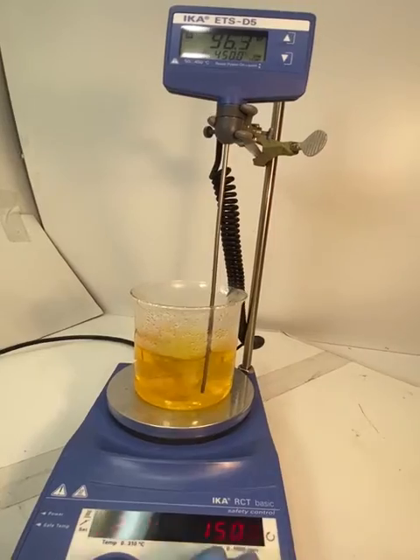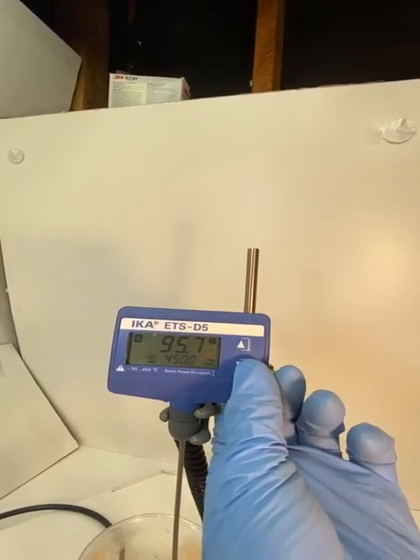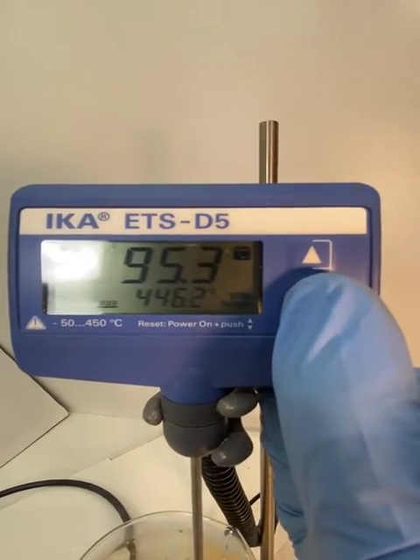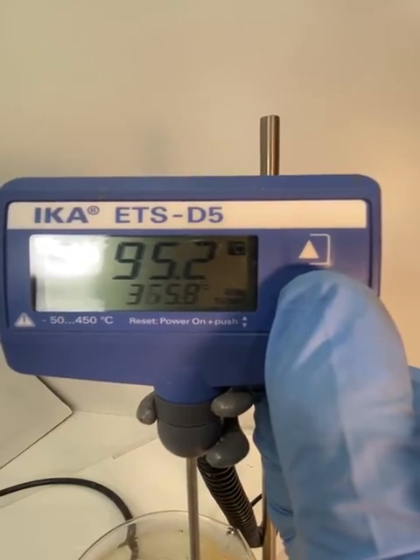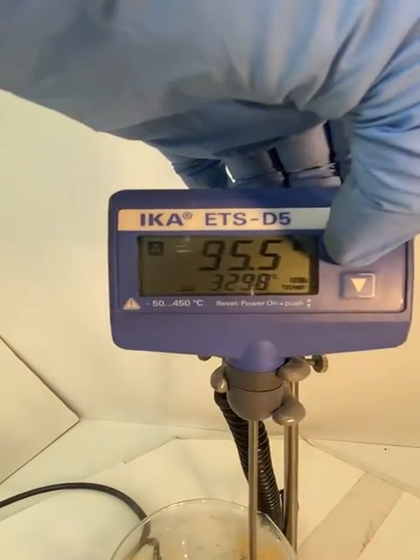I'm going to turn it off and show that the temperature sensor is also working fine. You can turn it down or increase the temperature as you wish.